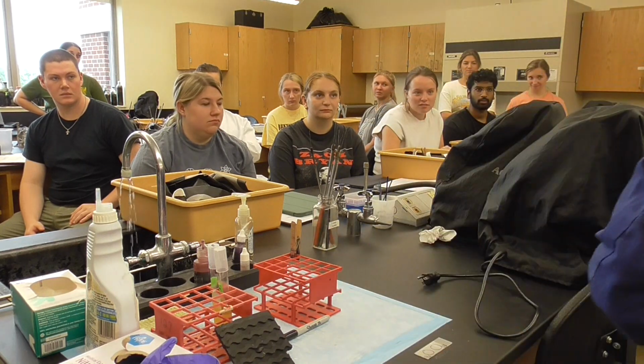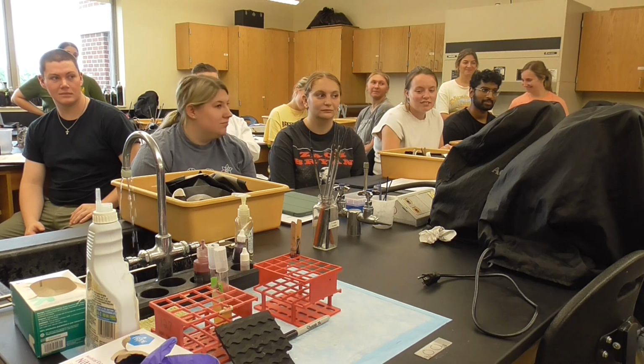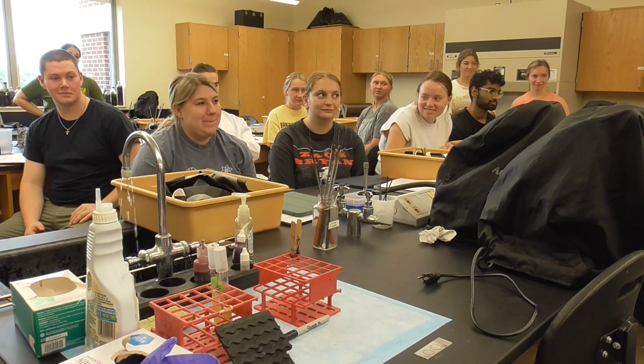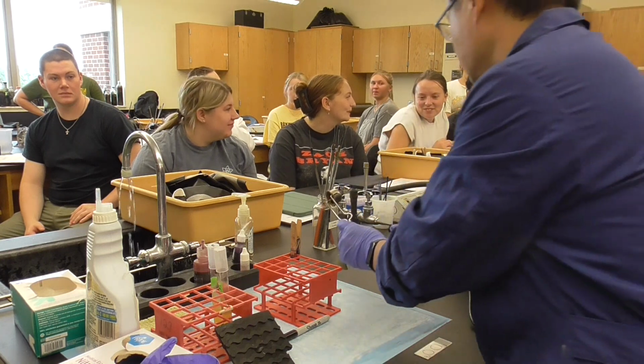Is this not good? Do you have a new one possibly? This one is good. Are you going to help them to switch back or not? Okay.